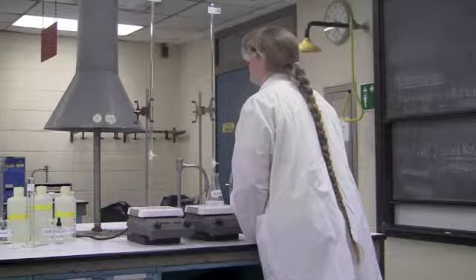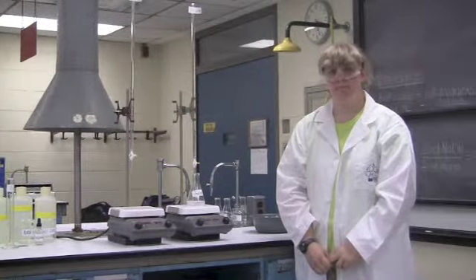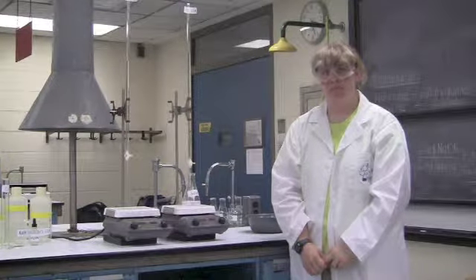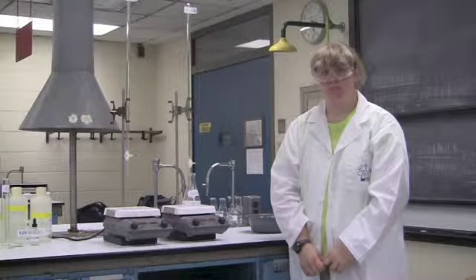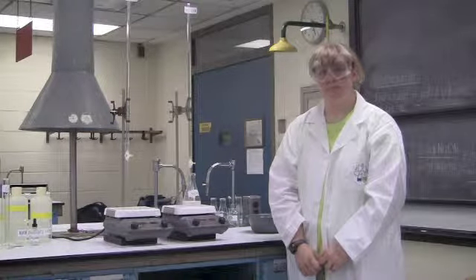The final volume reading is 13.07. A total volume of HCl added was 13.07 ml. Now we are going to show through the calculations how this makes sense.